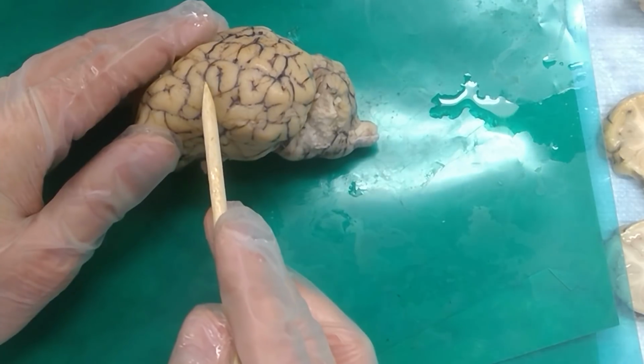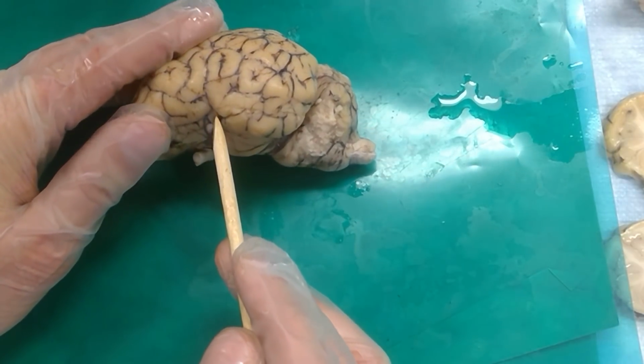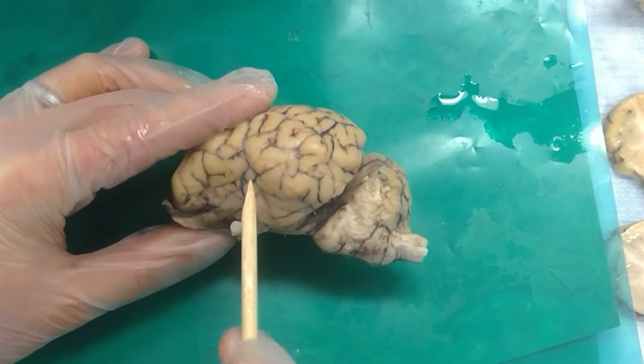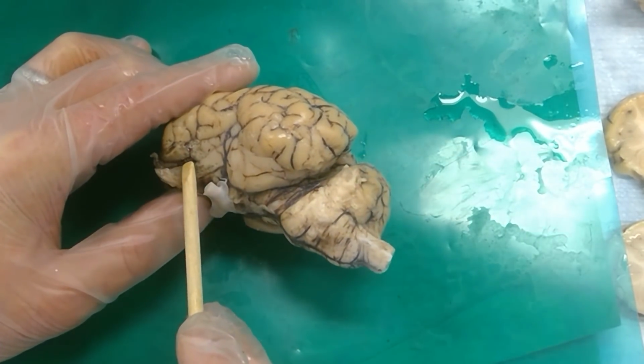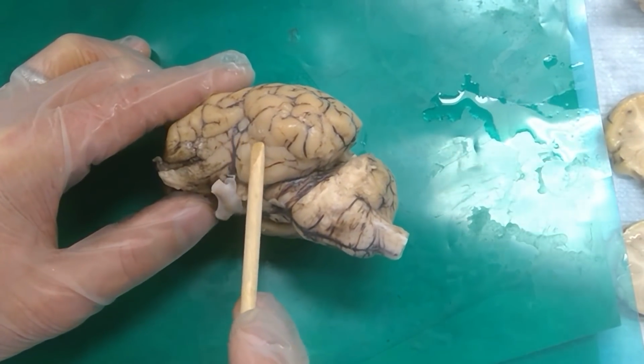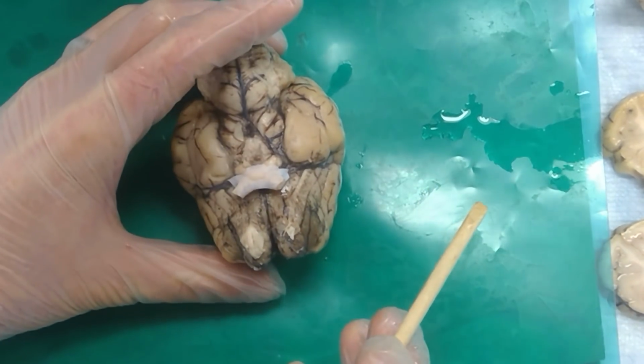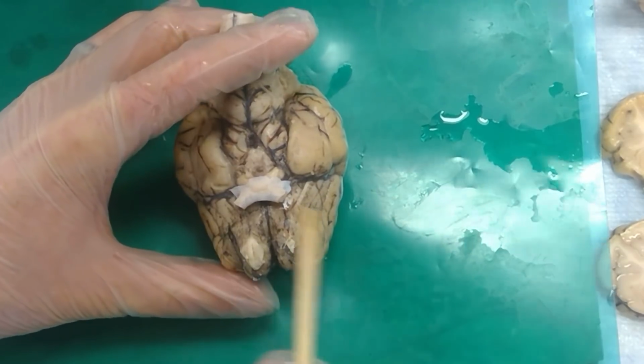or jump back over the gyrus to this sulcus. Sulcus. Which goes to this little dip in the brain right here. Insula. Right. And then we've got this fissure that runs along the side of the brain here. Rhinal fissure. Look at you guys. You're ready for this. If we can take it as a group, it'll be fine.